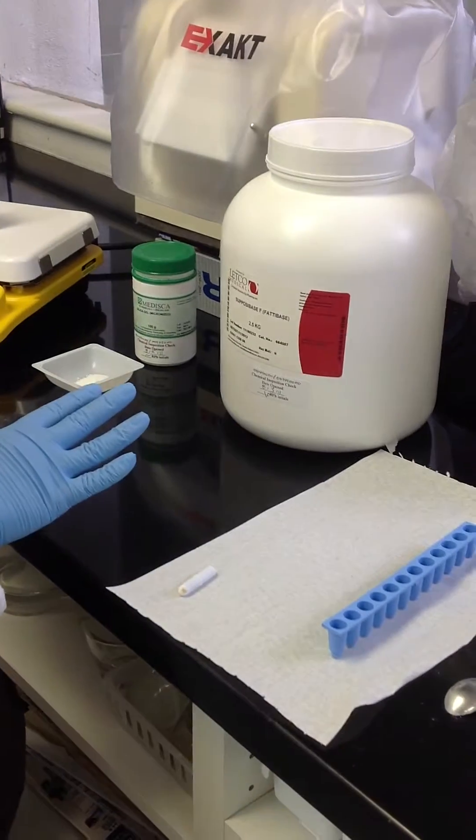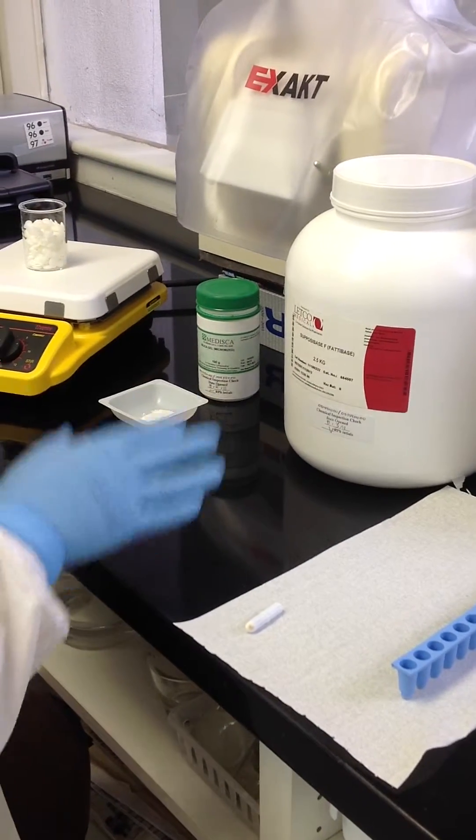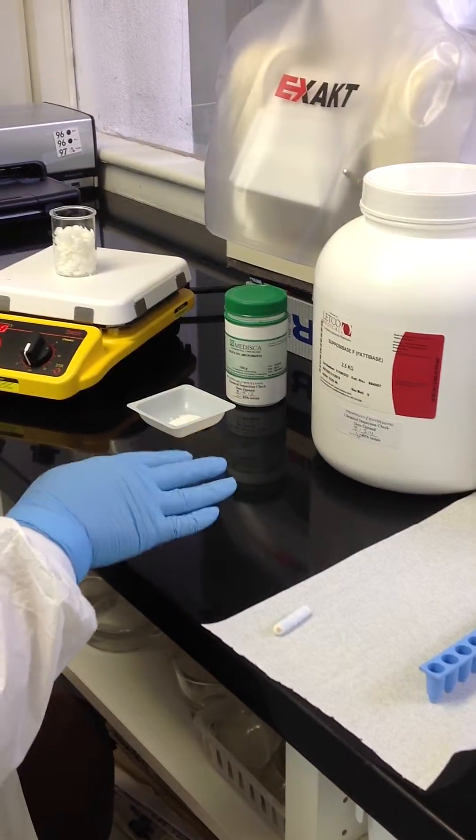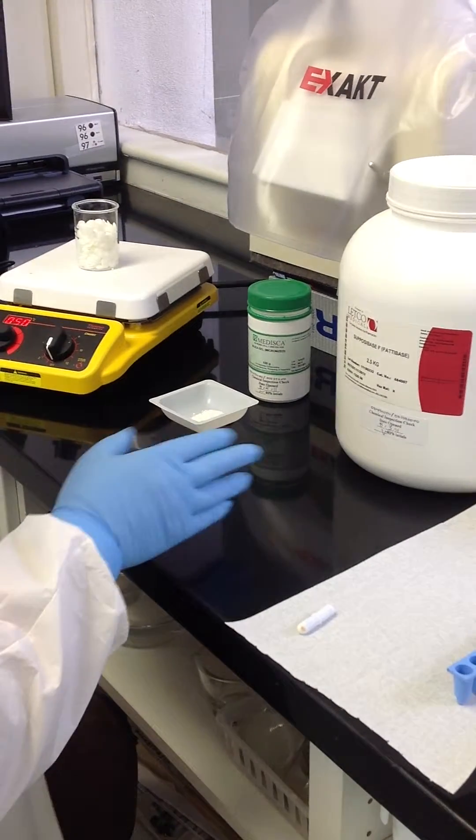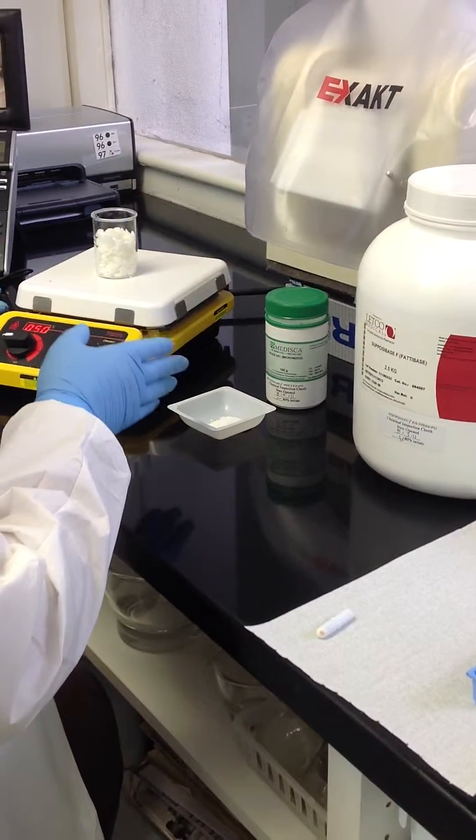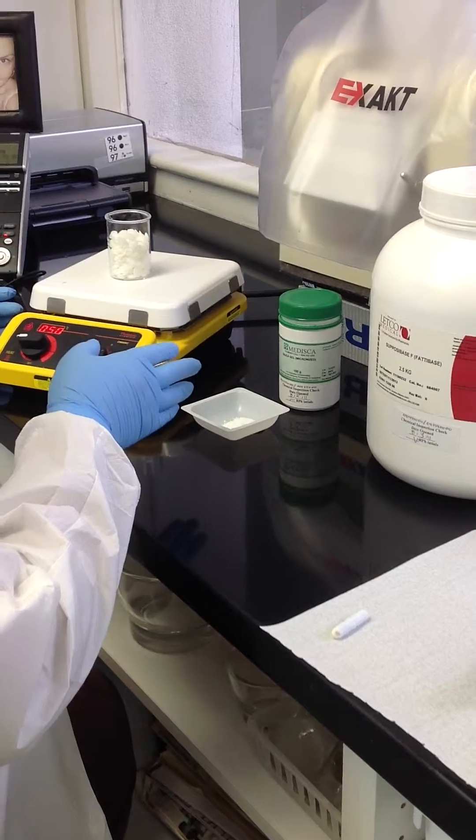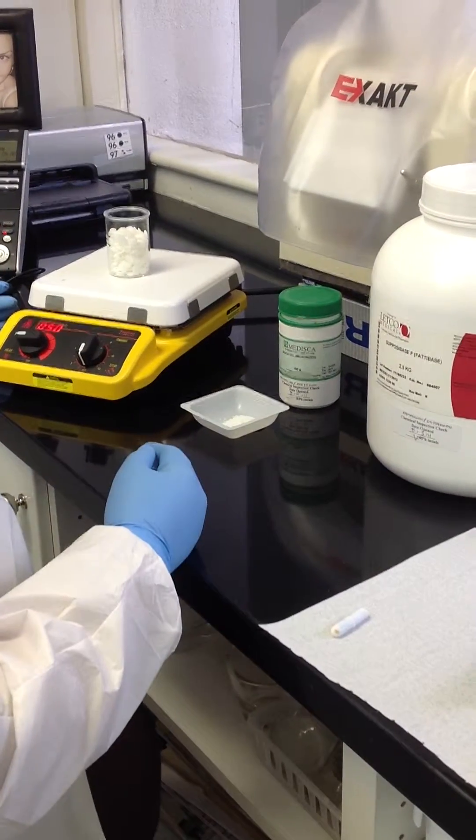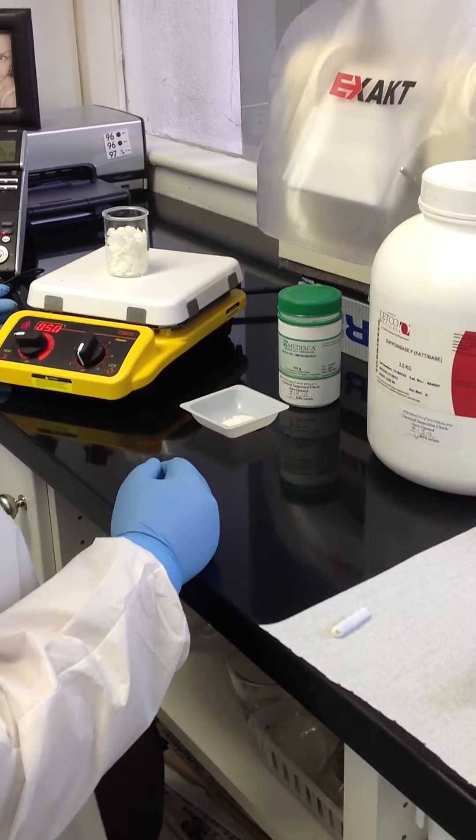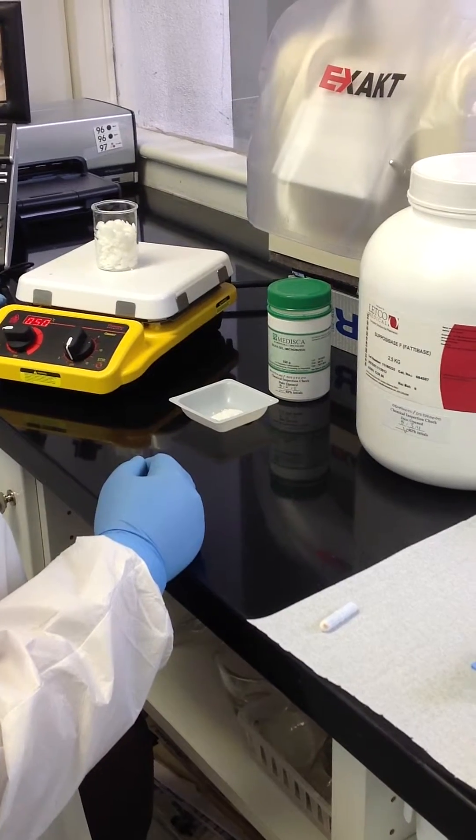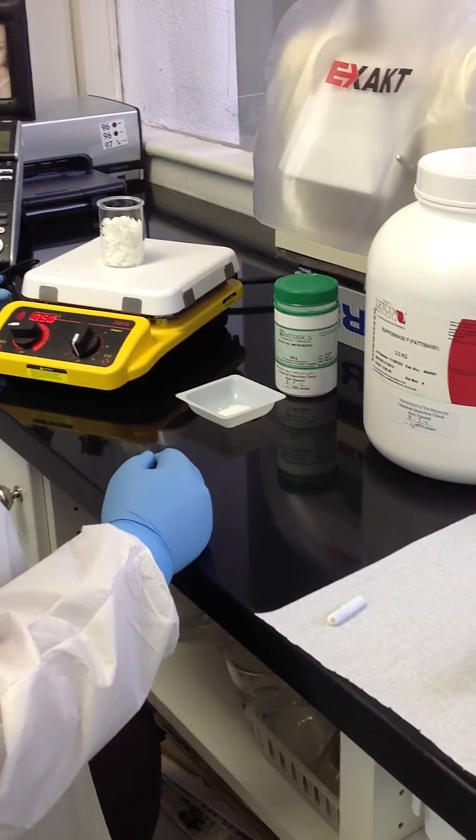Right now we don't have the manual thermometer, but we check the temperature of the melted base to make sure it doesn't exceed anything that would denature the active ingredient or any of the excipients. So it's going to take a while to melt.